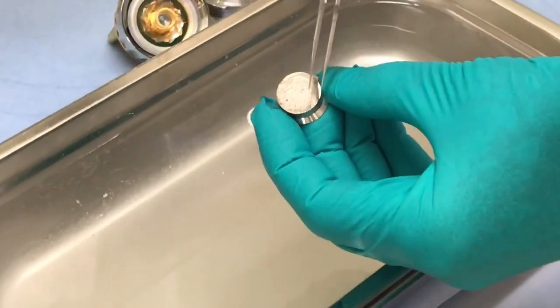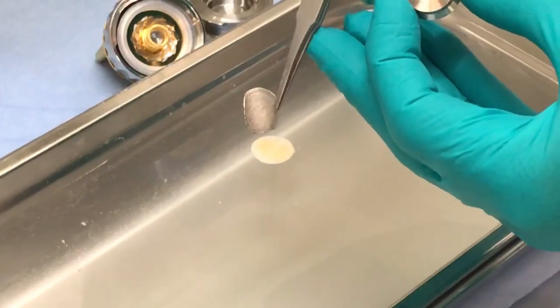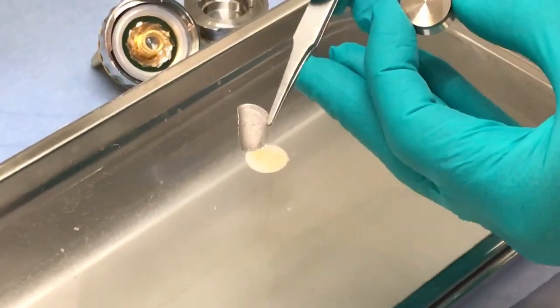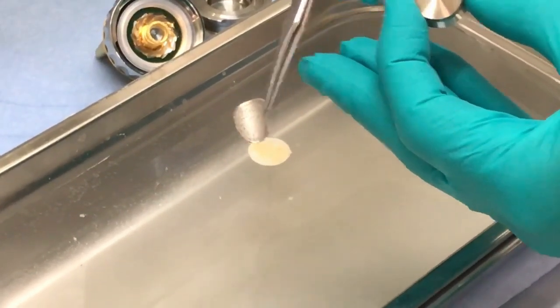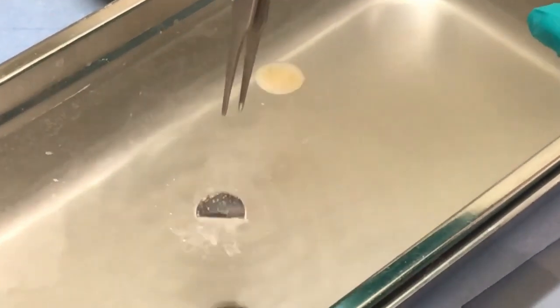And this is the NCM electrode — I see no reaction at all. And this is the upper lithium metal electrode: smooth and shiny on one side, and a little bit grayish due to the dendrites on the other side.